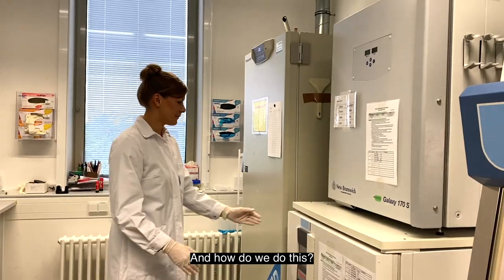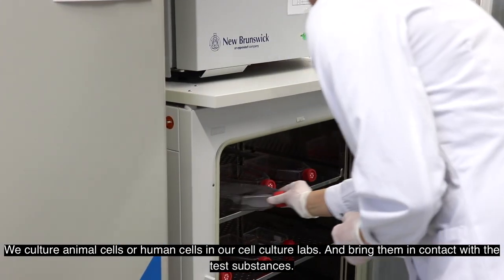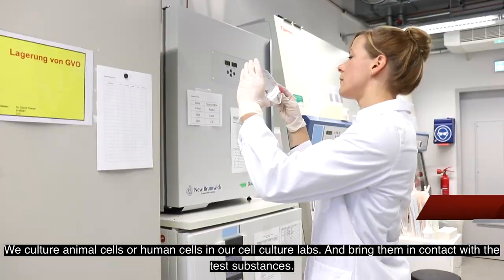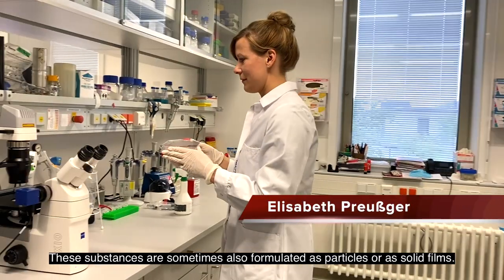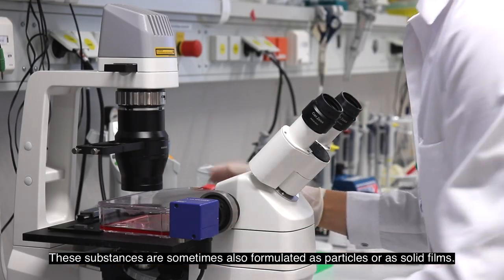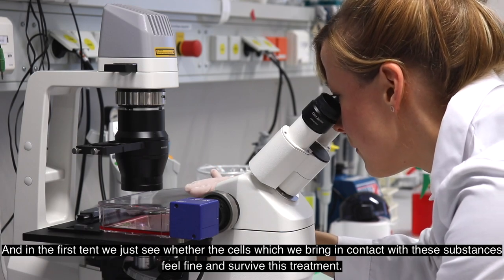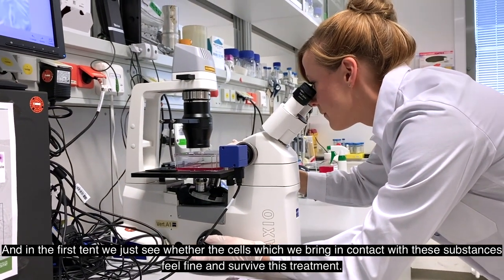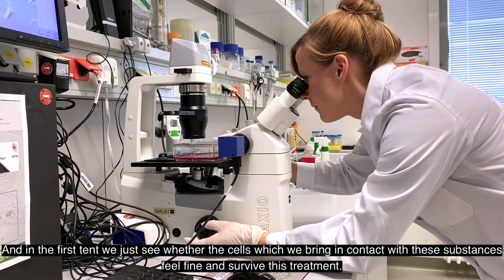We culture animal cells or human cells in our cell culture labs and bring them in contact with the test substances. These substances are sometimes also formulated as particles or as solid films. In the first instance, we just see whether the cells which we bring in contact with these substances feel fine and survive this treatment.